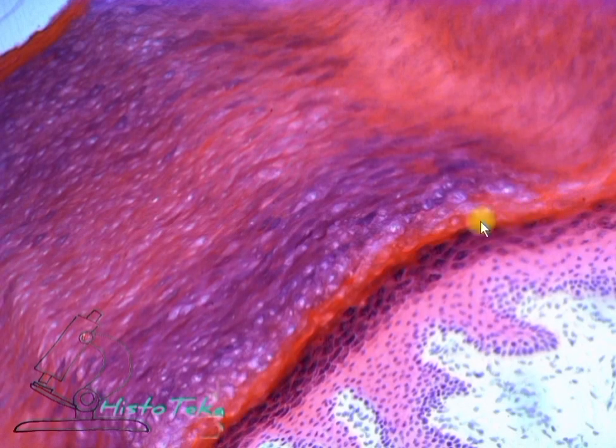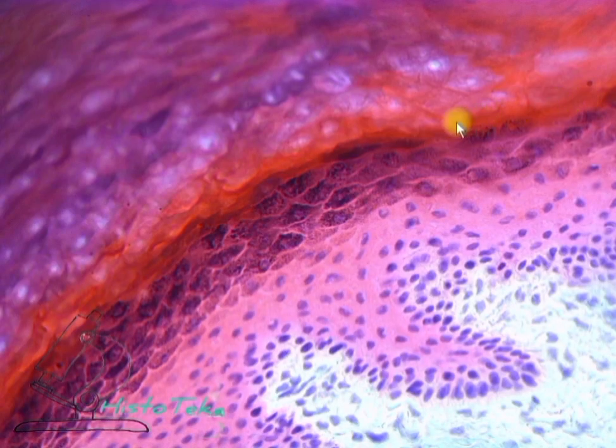There are also 3 to 4 rows of cells, flatter than in the previous layer, or rather postcellular structures, since they no longer have either nuclei or organelles. The contents of the cells are keratin. The shell is thickened due to the deposition of keratolinin, a protein under the membrane. The lucid layer is brighter because the light passing through it is not scattered, compared to the neighboring layers. This is because the refractive indices of the cell bodies and the intercellular substance are equal.